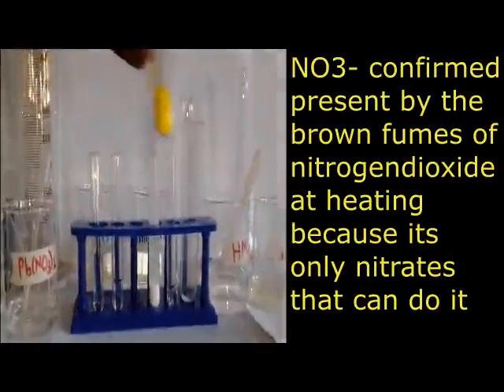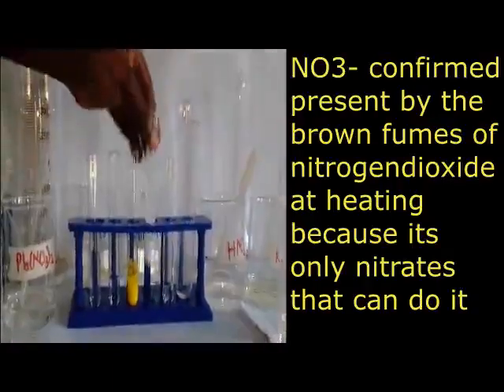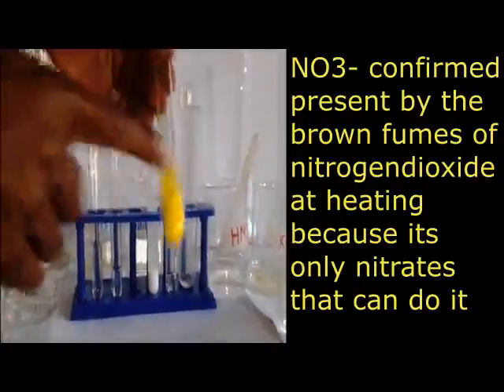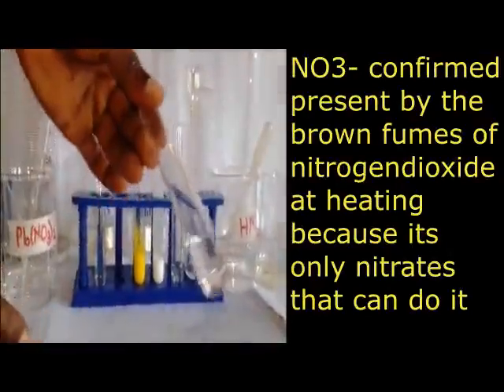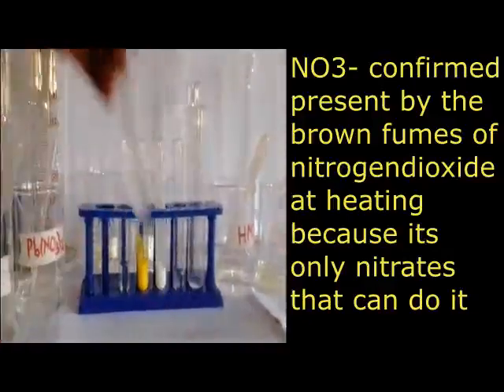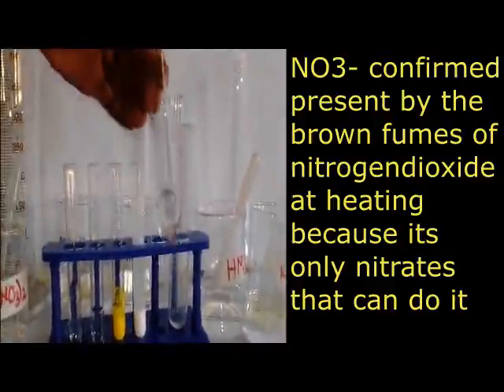We have been expecting lead throughout, so that is a confirmatory test. Then the fifth portion, where we added barium nitrate, no observable change, the solution remained colorless. Then our last test, adding barium nitrate and nitric acid, no observable change still, and our conclusion was sulfate ion is confirmed absent.